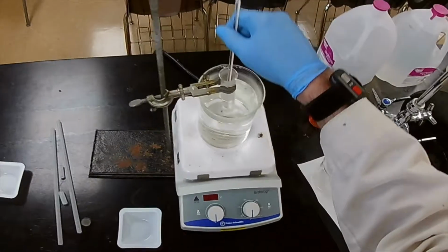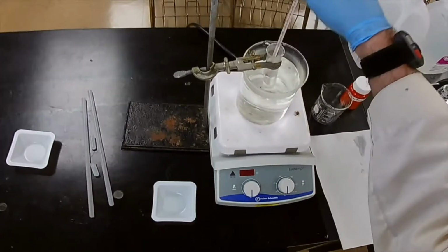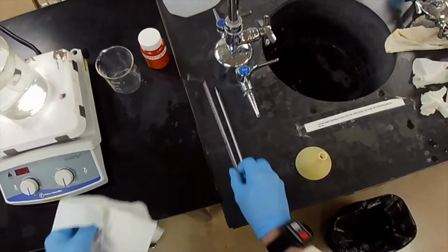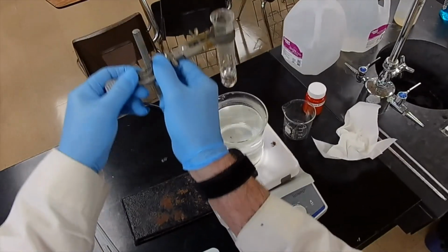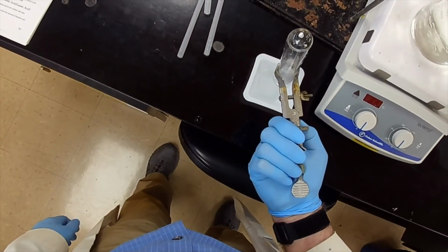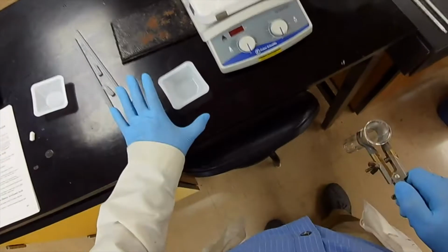And we take our thermometer out. Now we're going to wipe the thermometer. And while it's still liquid, we wipe that stuff off. Right. There we go. Then we take our tube out and pour it into the weigh boat. Like that. Get as much out as possible. Okay. Then when that solidifies, it's not toxic, so we can put it in the trash.